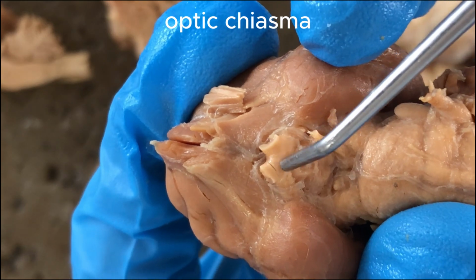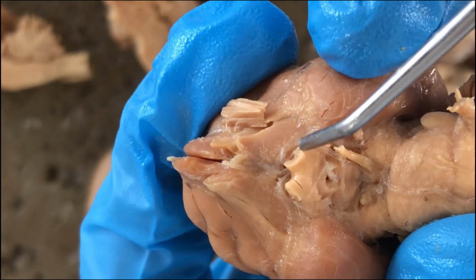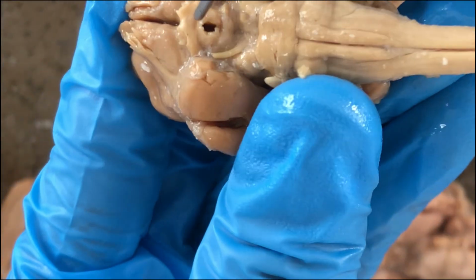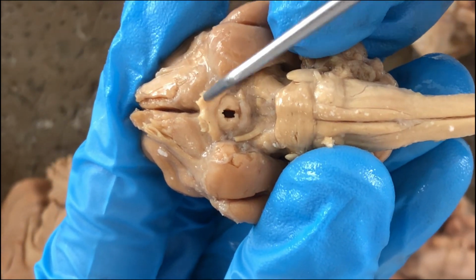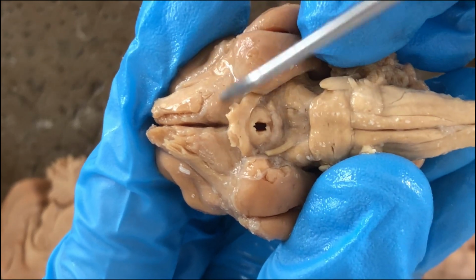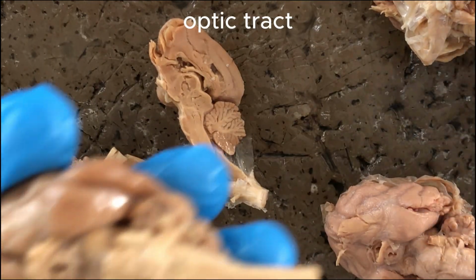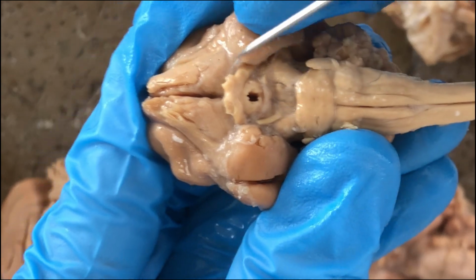It's the point of decussation or crossing of the 2 optic nerves. So here's another brain which has a better view of the optic chiasma. And here would be the truncated portion of the optic nerves, and then these would be the optic tracts. And this region, as I said, is the hypothalamus.